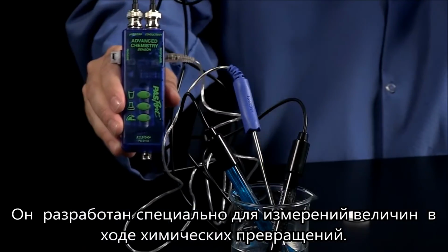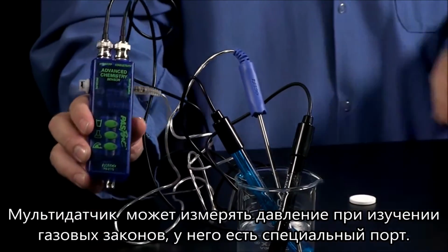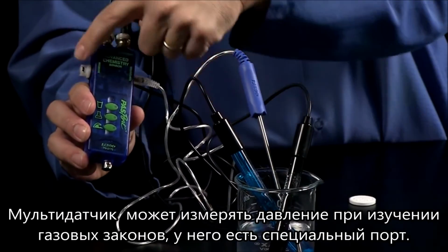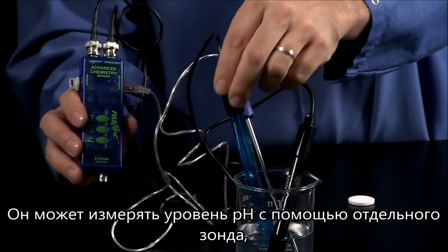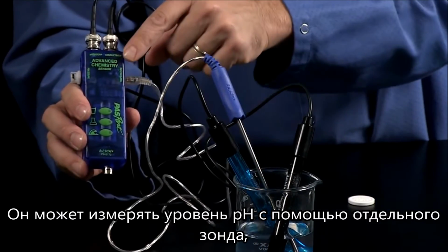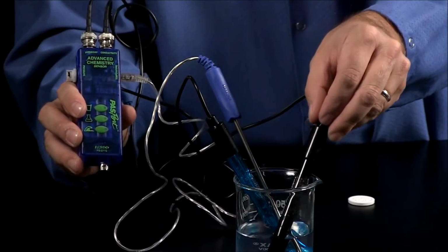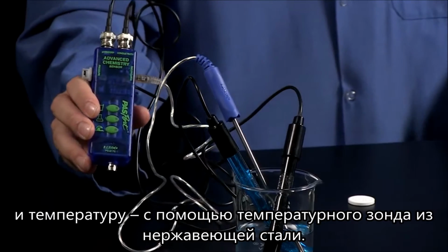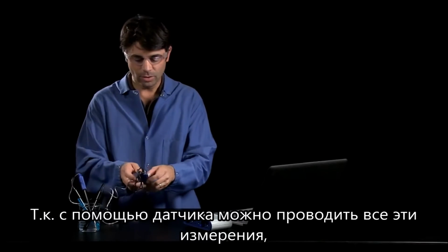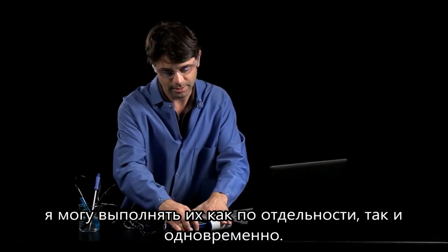The Advanced Chemistry Sensor is designed especially for chemistry. It's a new multi-measure sensor that can measure pressure for gas laws, has a port for a pH probe, can measure pH, conductivity with a 10x conductivity probe, and temperature. It comes with a stainless steel temperature probe. Because it has all these measurements, I can make all those measurements individually or simultaneously.